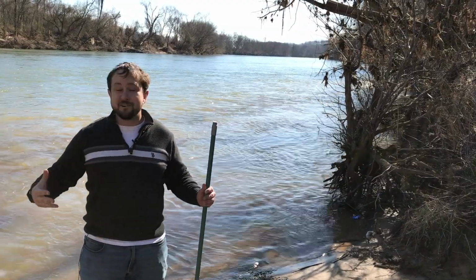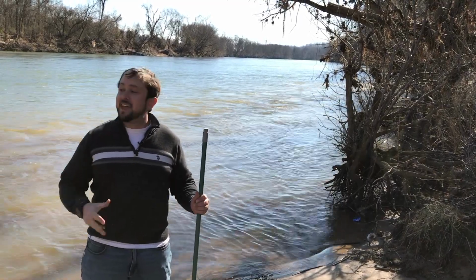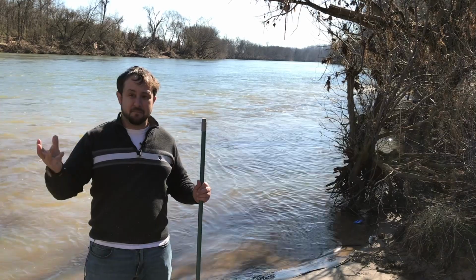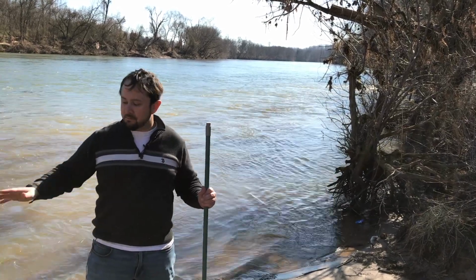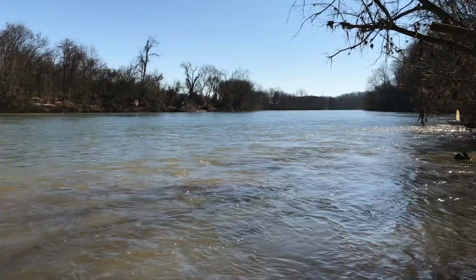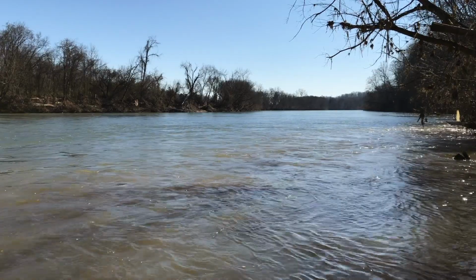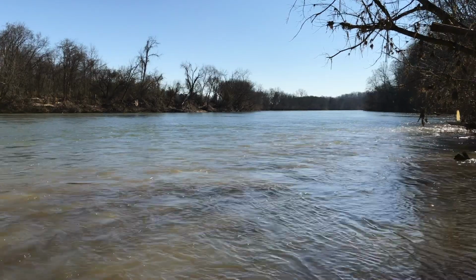This is a very large river, so now we're going to test the turbidity here on the Yadkin River. I do have to say that it rained over the weekend, so we're going to expect some more suspended solids in our water, but it should be relatively clear. It's also winter time here, so we're not going to worry about the algae and other particulates that might cloud up the water and give us a higher than usual turbidity reading. So let's get to sampling.